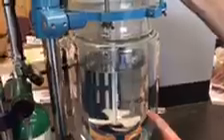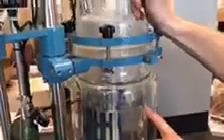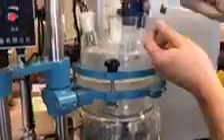So we can pull this up, and let's say you want to take a sample out right here. Let's say the bacteria is looking brown or a different color and we want to analyze it. So now we put our probe down to this level, and we have a little primer bulb that will actually suck from here, and it will bypass and pump right back into the tank. So now what we do, as you can see, the air bubble will lift up. We will slowly pump this up. As it's rising up, we've used clear tubing so we can actually see.